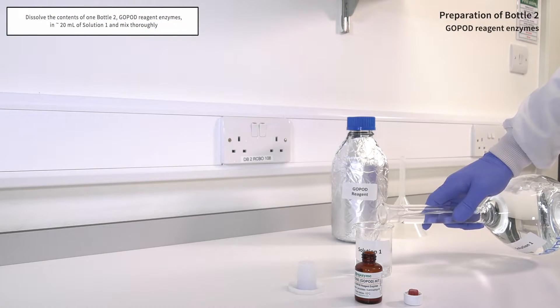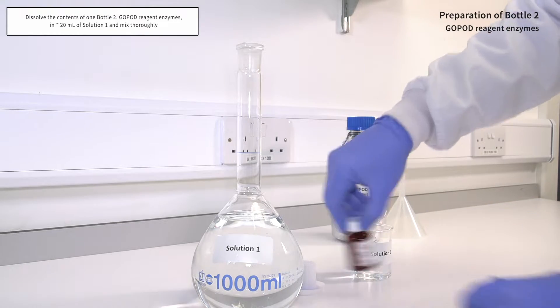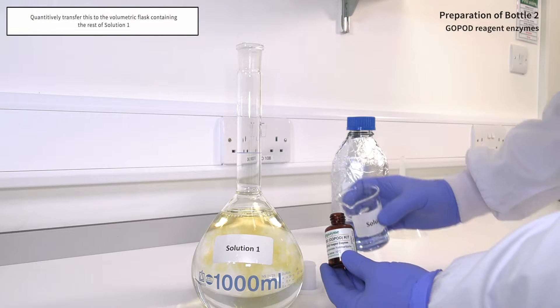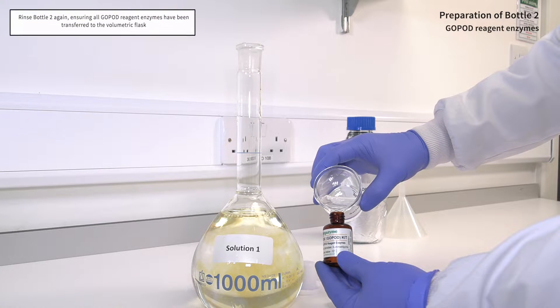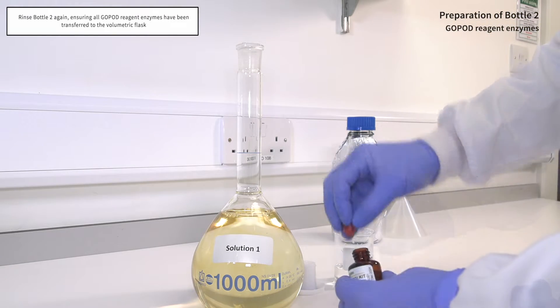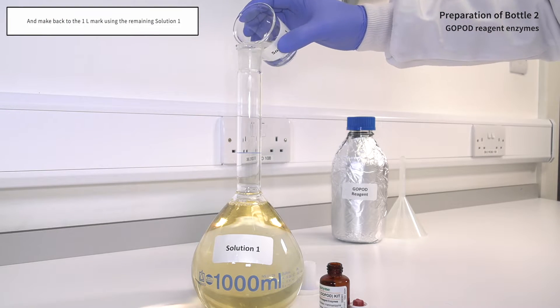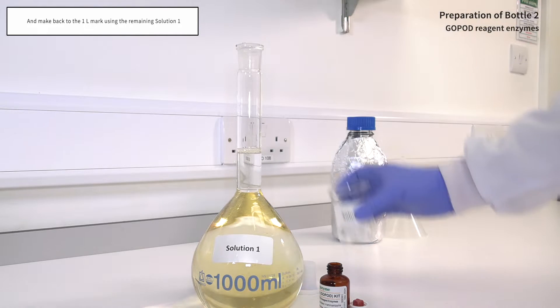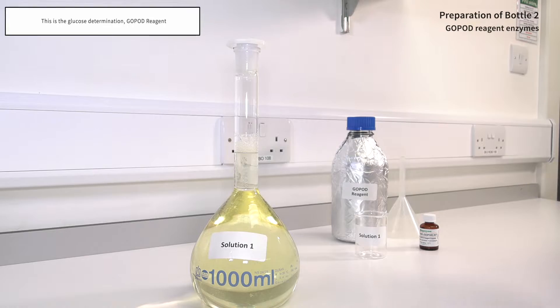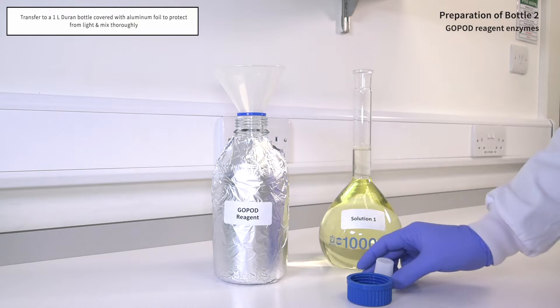Dissolve the contents of one Bottle 2 GOPOD reagent enzymes in approximately 20 ml of Solution 1 and mix thoroughly. Quantitatively transfer this to the volumetric flask containing the rest of Solution 1. Rinse Bottle 2 again, ensuring all GOPOD reagent enzymes have been transferred to the volumetric flask, and make back to the 1 litre mark using the remaining Solution 1. This is the glucose determination GOPOD reagent.